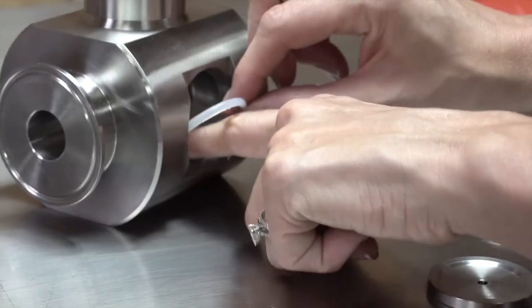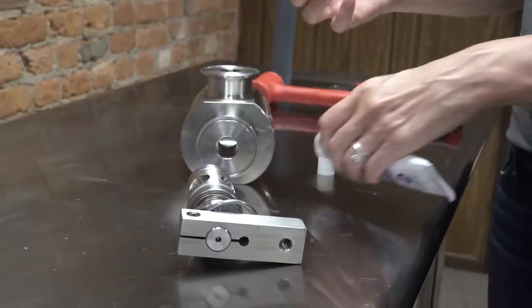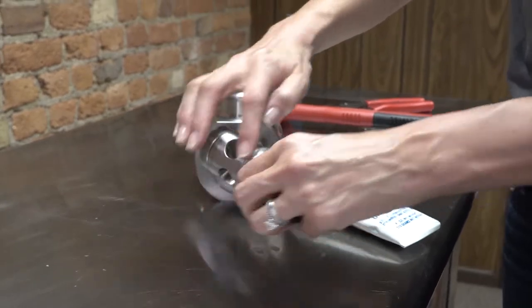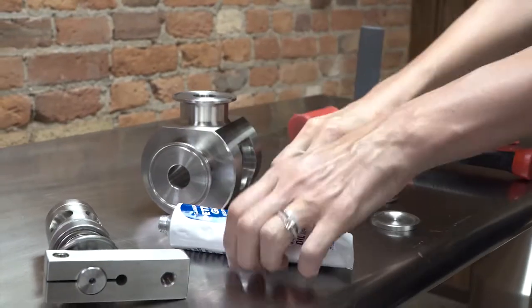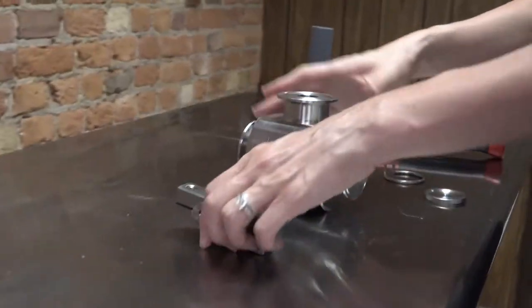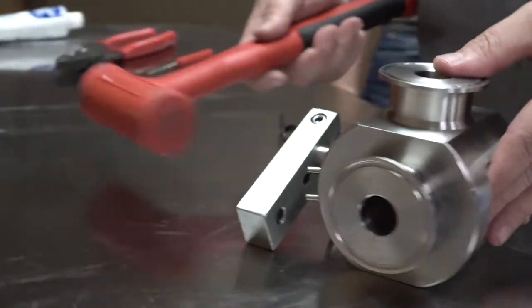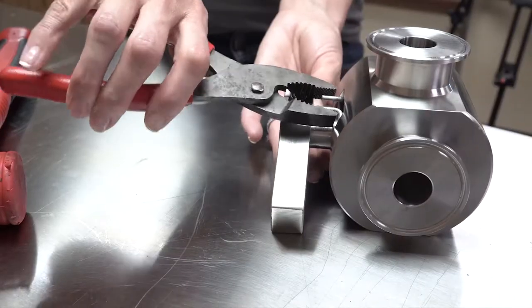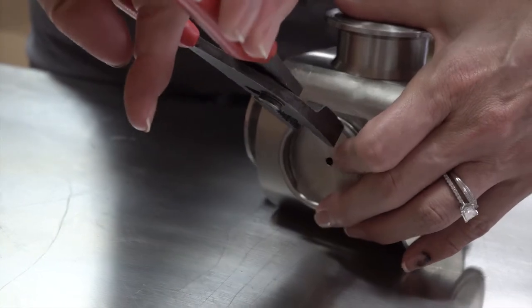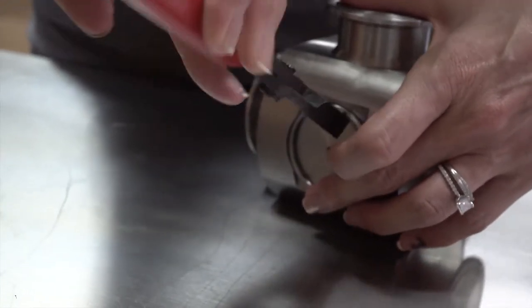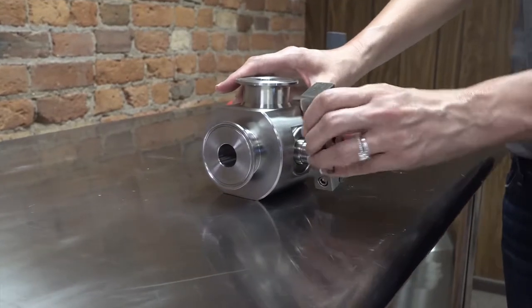Reinstall both o-rings. Apply a small amount of lubricant to both o-rings. Reinstall the core into the valve body. Replace the caps and the spring clamps. Hand rotate the valve its full motion to make sure it rotates freely.